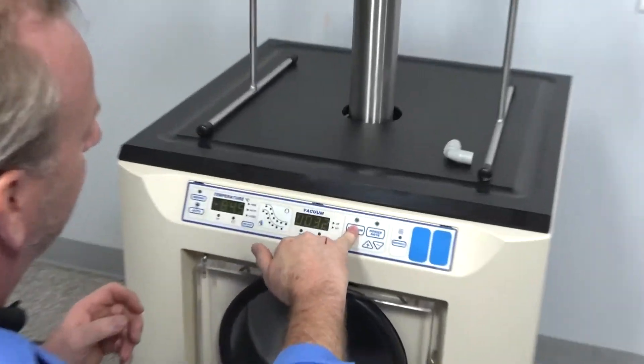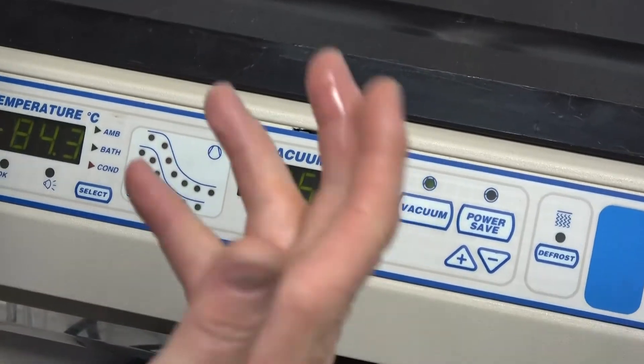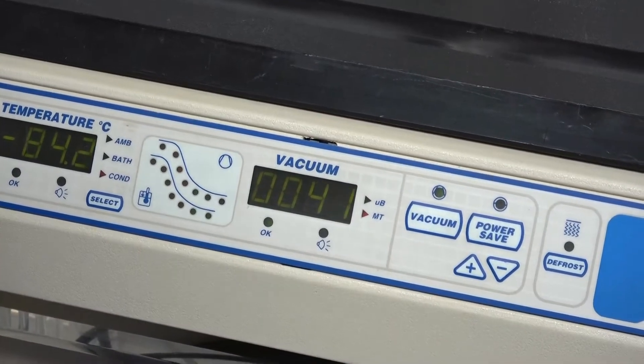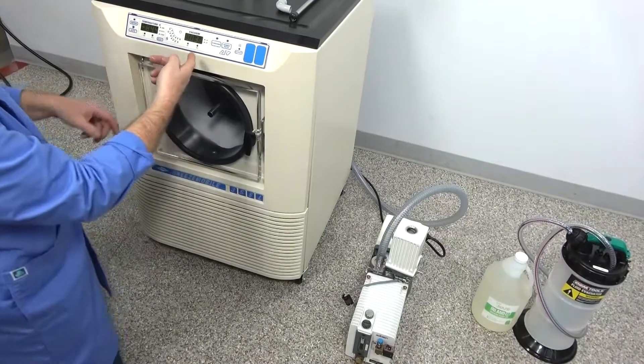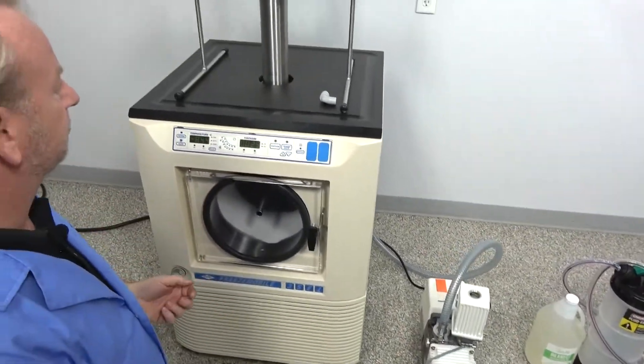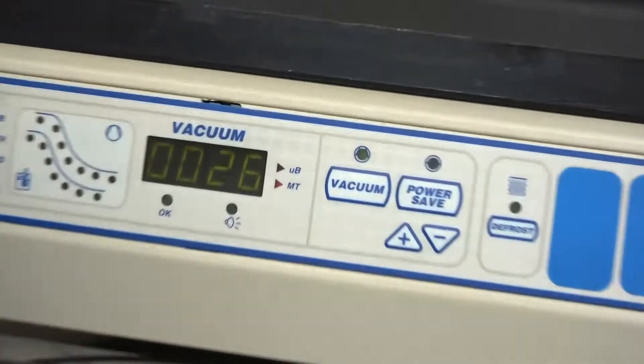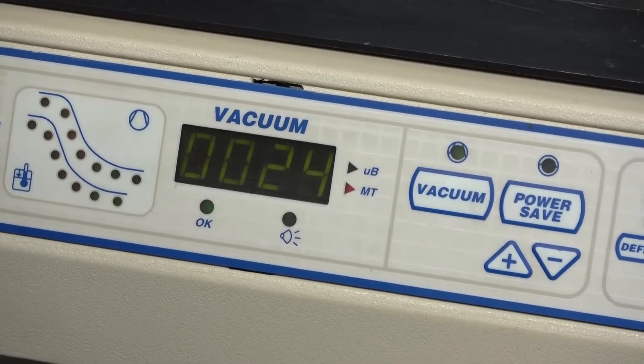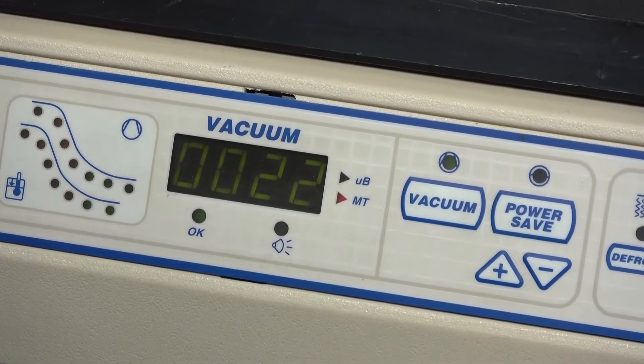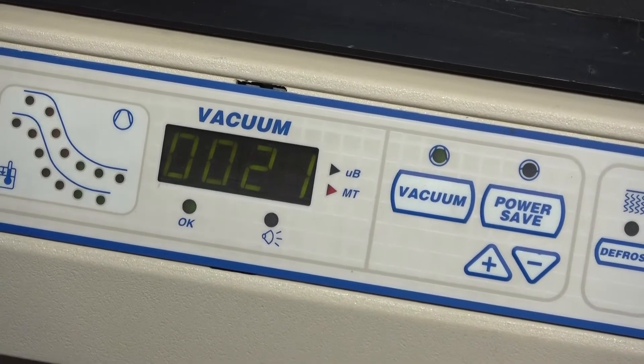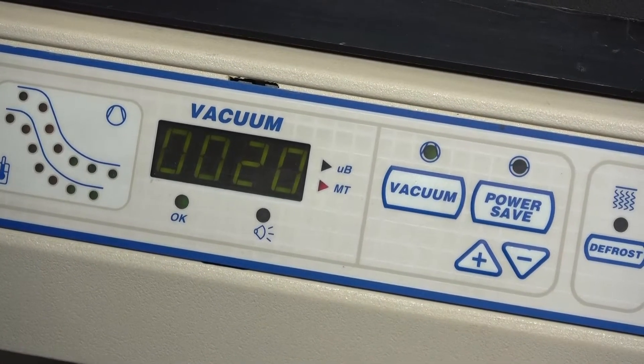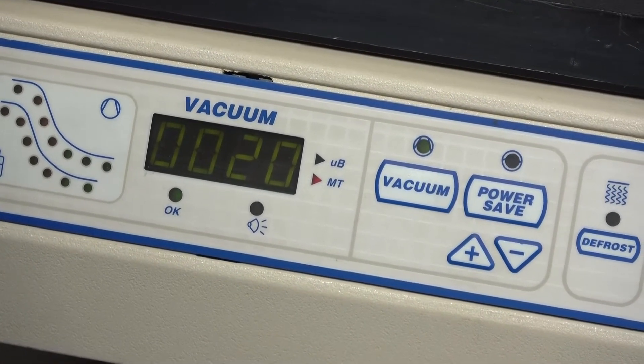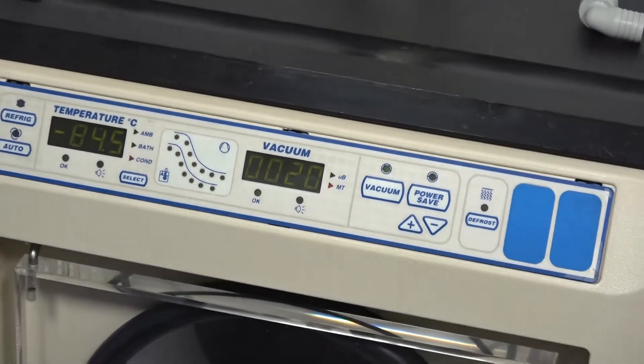See how it jumped up to 62 and you're thinking, well, why did it do that? Because we have a section of hose and we have the vacuum pump that it had to catch up. So then it can now start pulling back down to where it's going to get back down below 20 millitorr again. So super easy during a run. Don't have to shut it down to shut the vacuum off. Come over here, do an oil change and keep a good scheduled maintenance oil change on there. But now that we put new oil in, it'll get to 20 and drop below it.